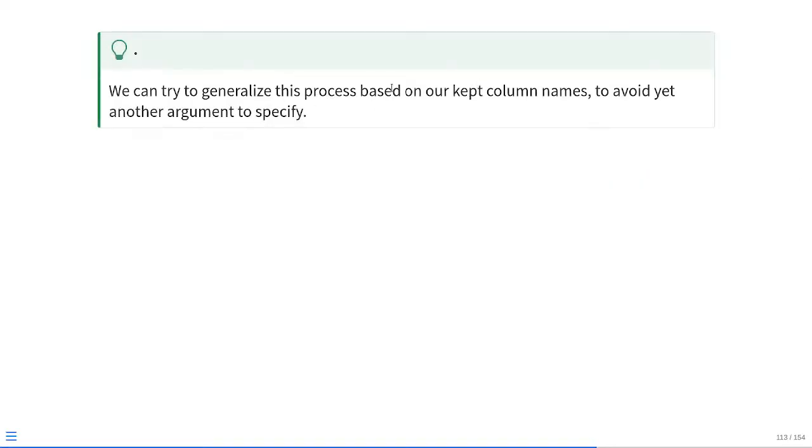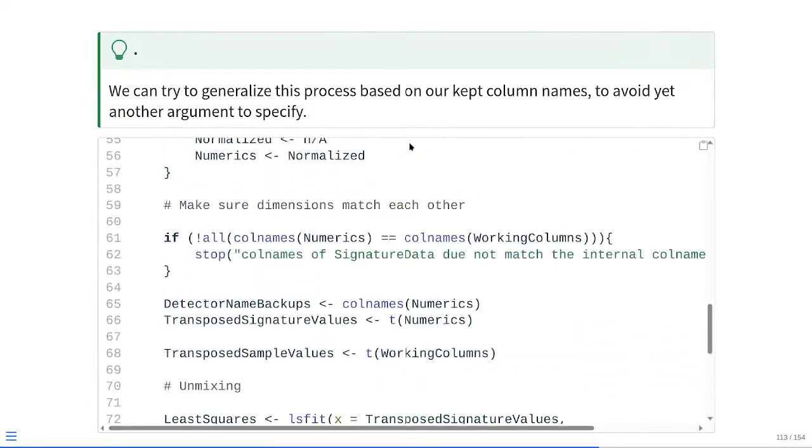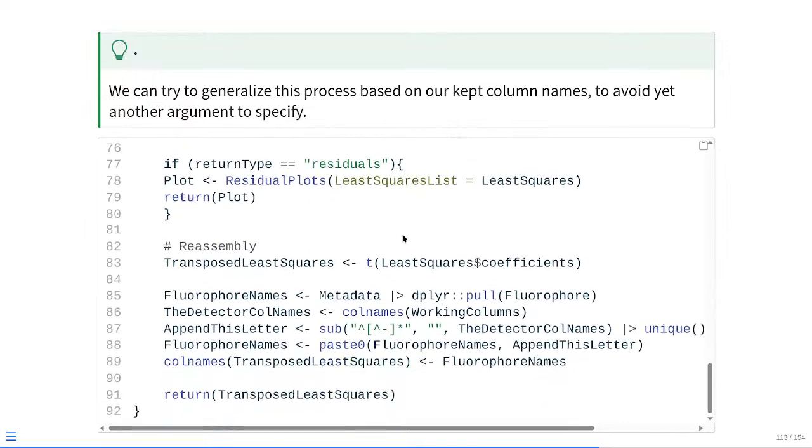So we can go ahead and try to generalize this process so we don't have to create yet another argument that we have to remember exactly what it does. We can generalize this based on what column names were actually being retained at the time we went to the unmixing steps. So what this is going to look like, no new arguments, we're just scrolling all the way down. And then at this point for reassembly, basically we need the fluorophore names, so we're going to retrieve them from the metadata. We need those working column names that are going to be the detector columns, so we save those to the detector column names.